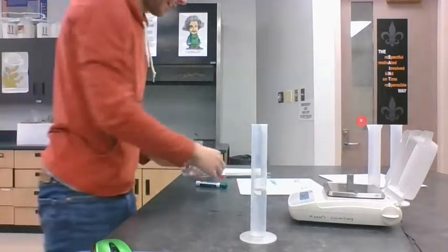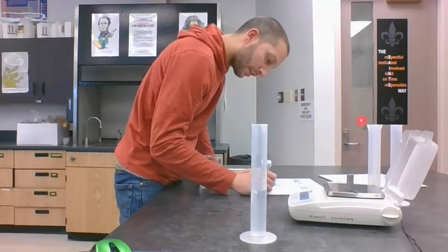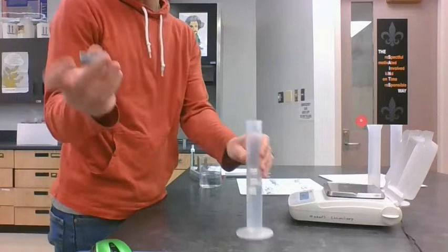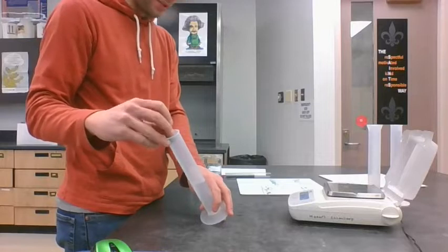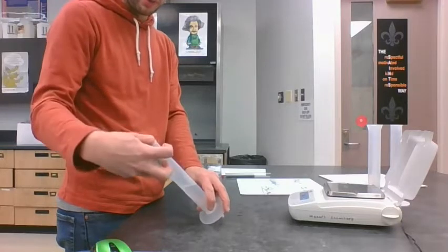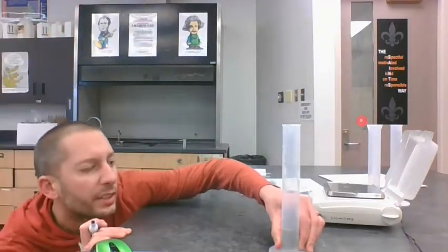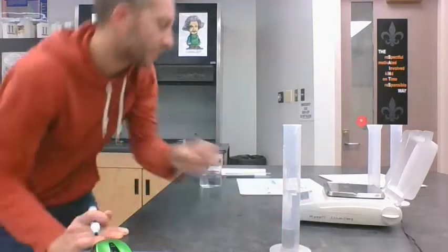All right, this time I got that set at 51. I'll let you guys do the subtraction this time, but it's right at 51.0 milliliters. What do you guys think is going to happen to this second piece compared to the first? When you looked at what happened to the mass, did it go up or did it go down? What about the size of the piece? Just from looking at it, what should happen to the volume when I drop that in? Let's see what we get. In the end, it looks like 58.0.